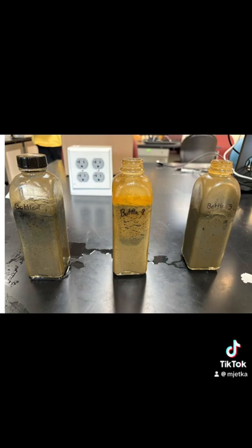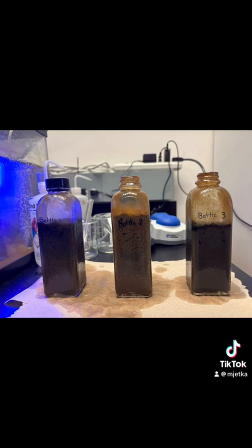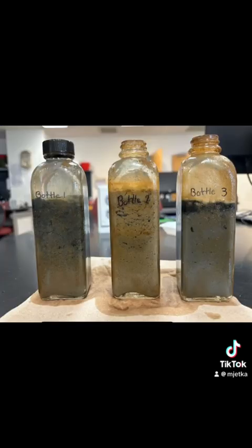being oxidized. In week 3, bottles 1 and 3 have thin, dark layers of sediment at the top of the sediment. In the last week of observations, bottle 3 has the darkest layer at the top, while bottles 1 and 2 have a slight color gradient with darker sediment at the top and lighter sediment at the bottom.